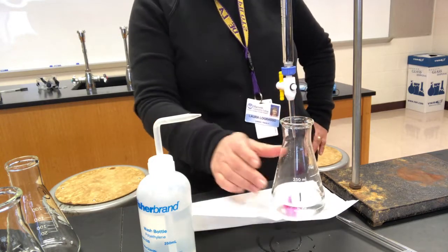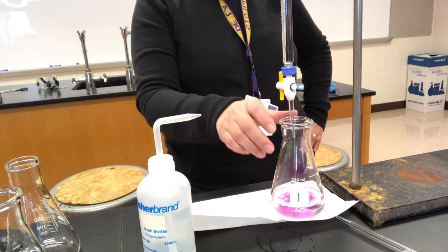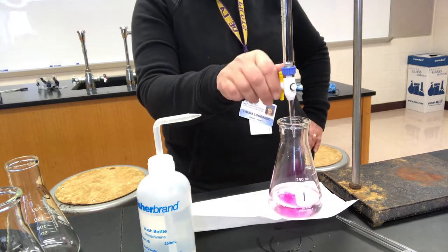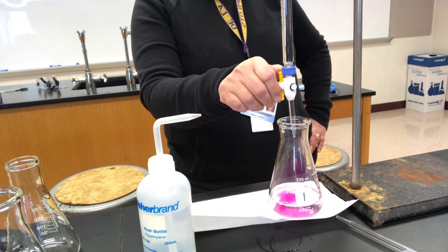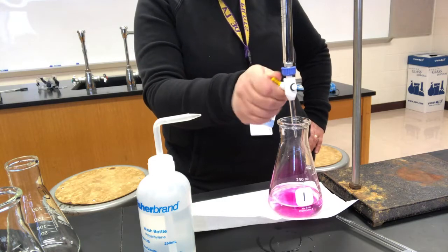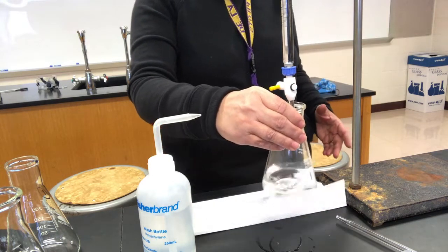Turning red, but I'm not worrying. I am unafraid. And pretty soon I'm going to stop it. And we're going to stop right here. Yeah, swirl, swirl. Look, it went away, no problem. I'm not to the excess yet.